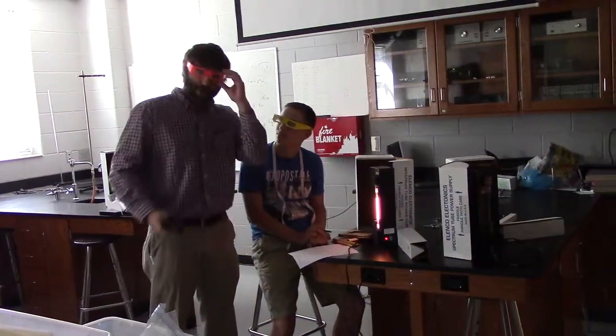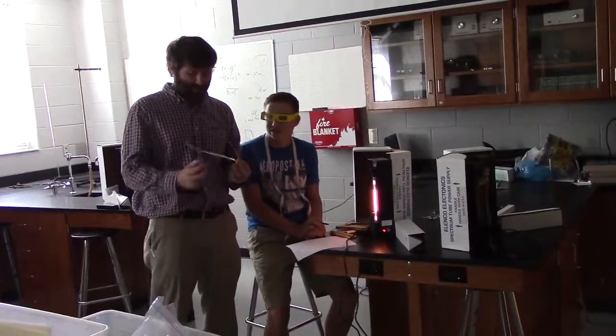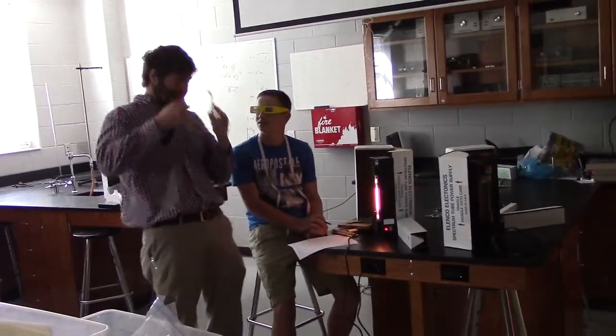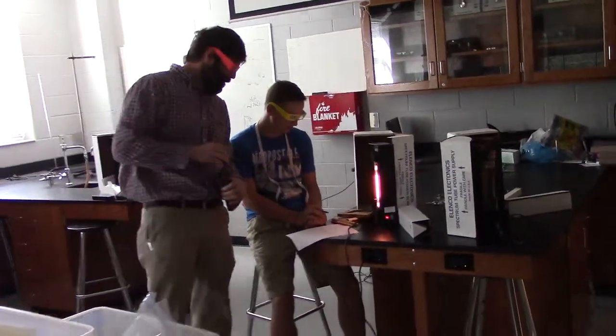I'm going to have a spectroscope. We're both wearing some goofy looking glasses, they're actually called diffraction glasses, but we'll take those off, or I will in a second. Sam's going to wear them just to help me see some things. So come on over here, and let's see if y'all can see what I'm actually seeing through my glasses right now.